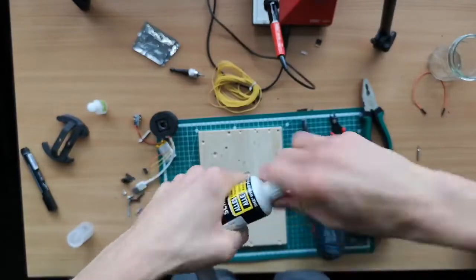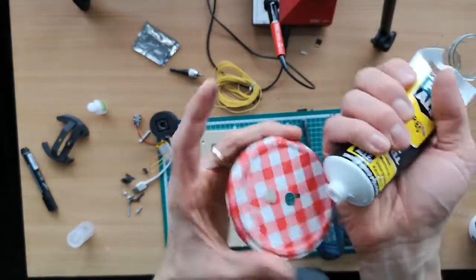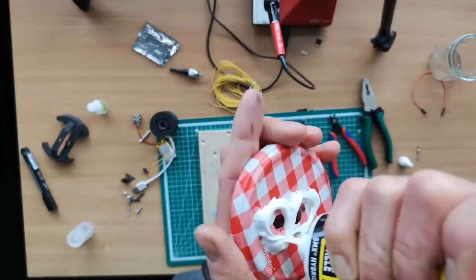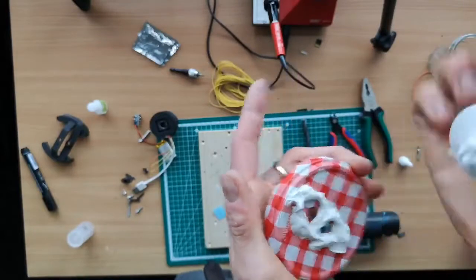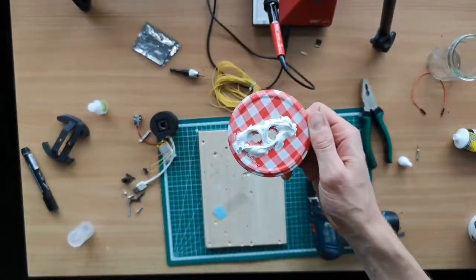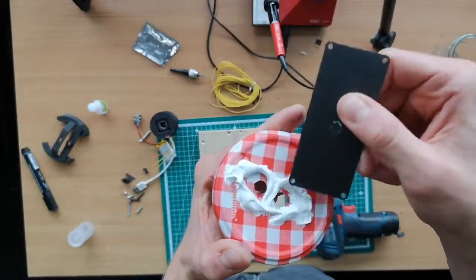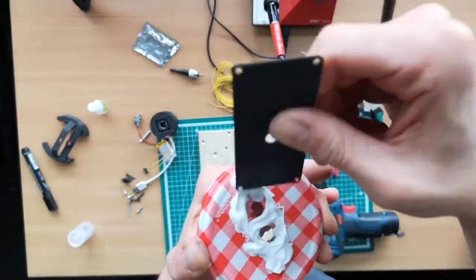So we have to add some of the parts here, and make sure that you don't cover the holes. Add lots of stuff so that it's getting sealed properly, so that there's no way that any air is coming in. So I just use lots of stuff, and then use some spare 3D printed part to put it away. For example here, I just make sure that it's not too close to the hole so that it's not blocking the optics, but everything's fully covered.